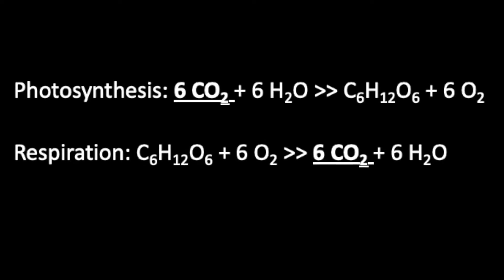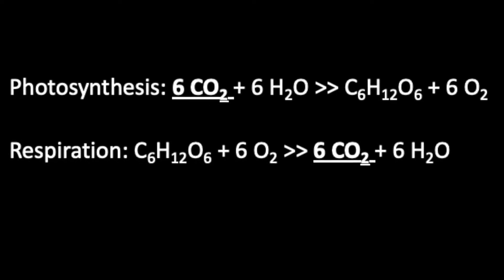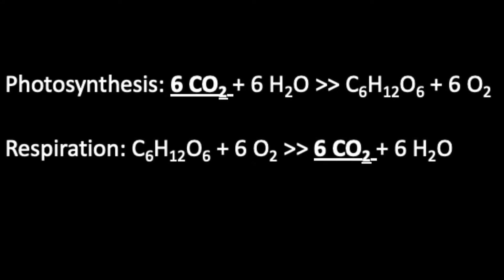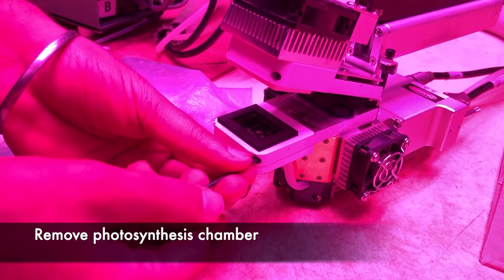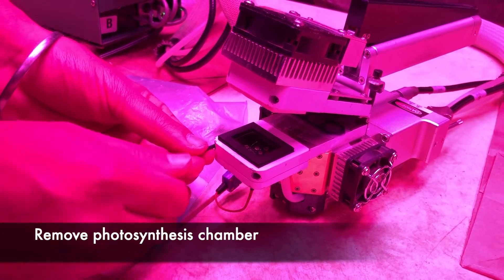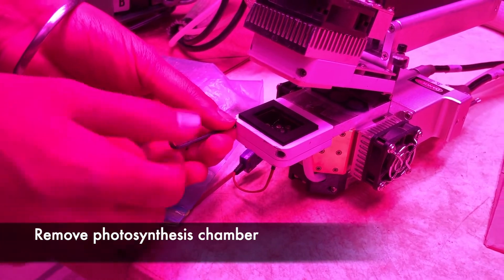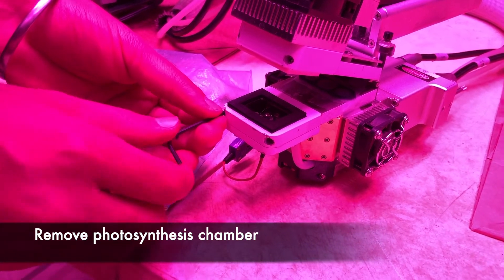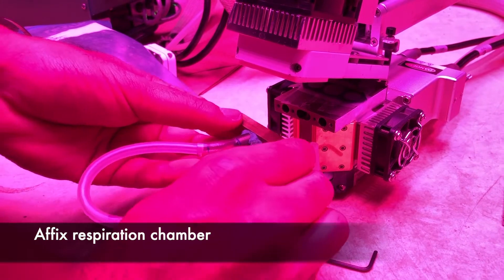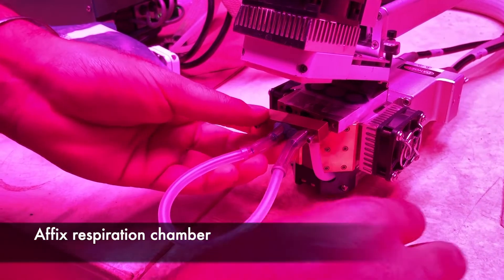To set up the LI-COR 6400 for measurements of root respiration, a few hardware modifications to the system will need to be made. First, we need to remove the leaf chamber that is used for photosynthesis measurements by unplugging the thermocouple assembly, unhooking the chamber exhaust tube, and unscrewing the lower part of the chamber. We then attach our custom respiration chamber in place of the lower part of the leaf chamber.